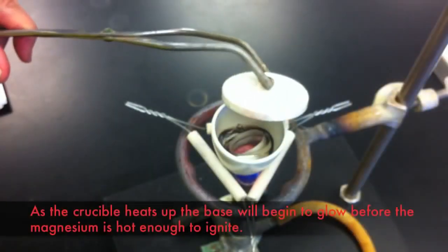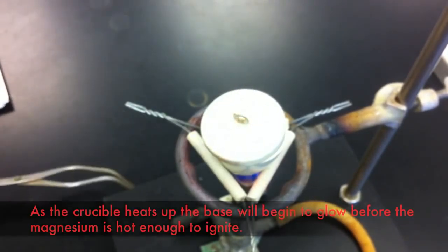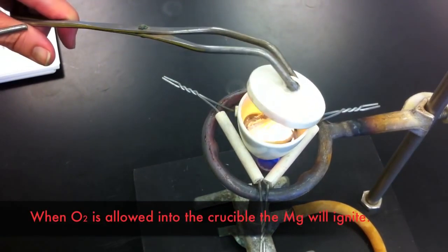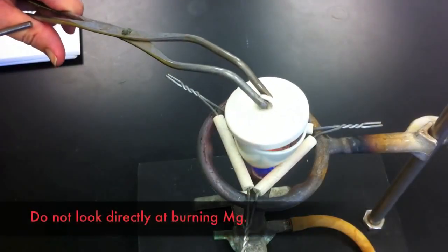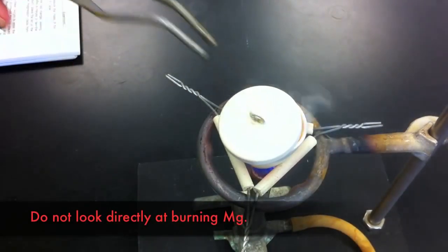The high temperature will cause the magnesium to ignite, though first the crucible will begin to glow with the heat. Raising the lid of the crucible will allow oxygen from the air to enter the crucible. This will ignite the magnesium, causing the formation of magnesium oxide. Do not look directly at burning magnesium. The intense light can damage your eyes.